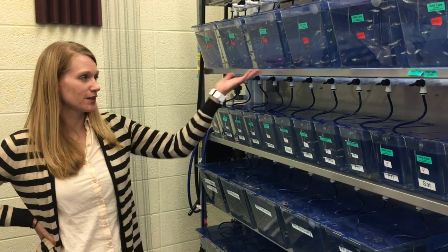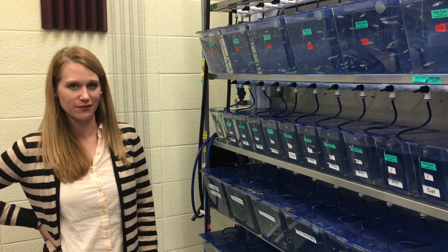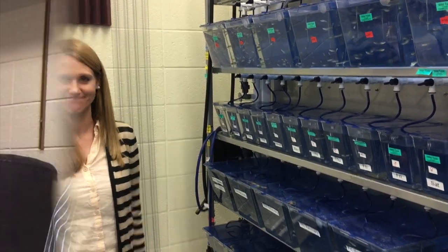These are the fish that you will be working with — these are the adult wild type fish. We can actually get our embryos from this fish right here. As a student in this class, you can look at how certain toxicants affect zebrafish behavior, regeneration status, or certain vasculature aspects of the zebrafish using image analysis.